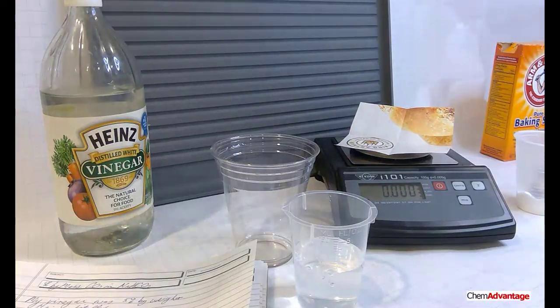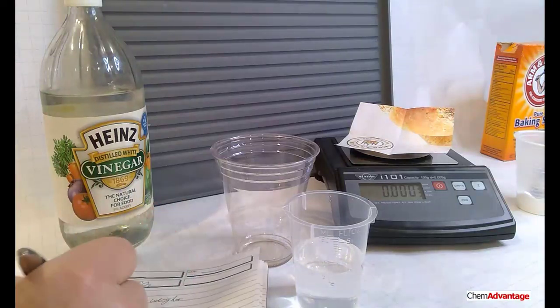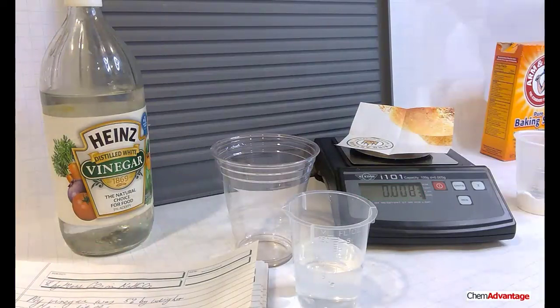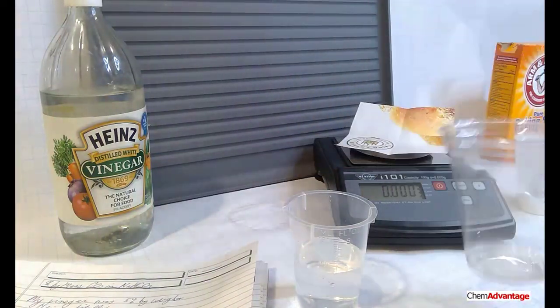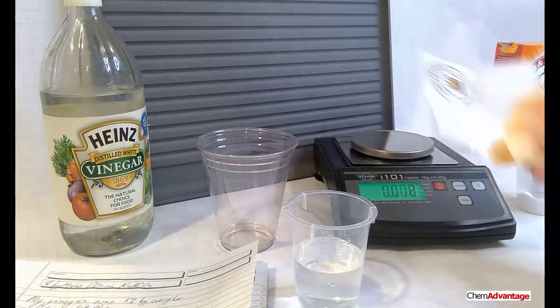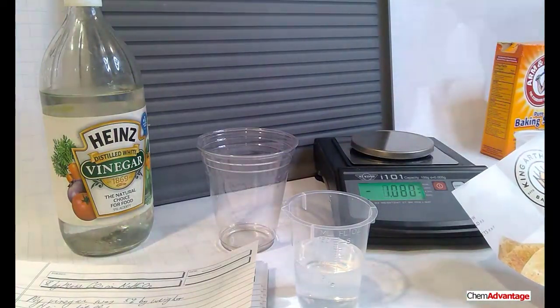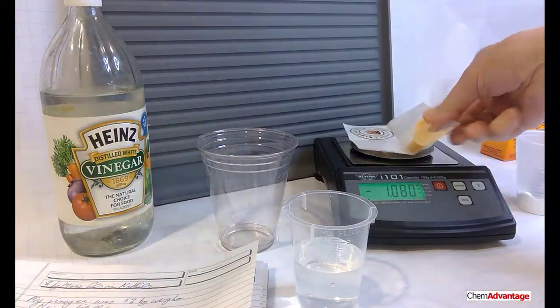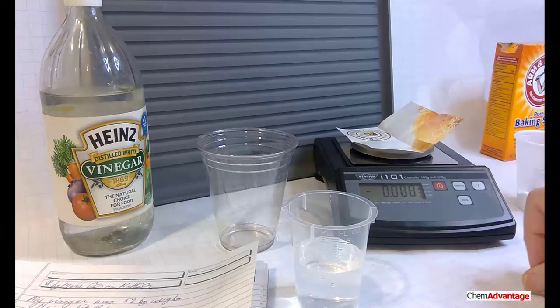Let me just write down that I've got about 60 mLs of acetic acid. Okay, here we go. Got my pen. 60 mLs. I've got a table set up ahead of time, so it's easy to do. And I'll put that aside. My next thing is going to be weighing my baking soda. I've got a Slick magazine here, some of my King Arthur Baking Company catalog, and I'm going to zero that piece of paper, my weighing paper, which is pretty classic.